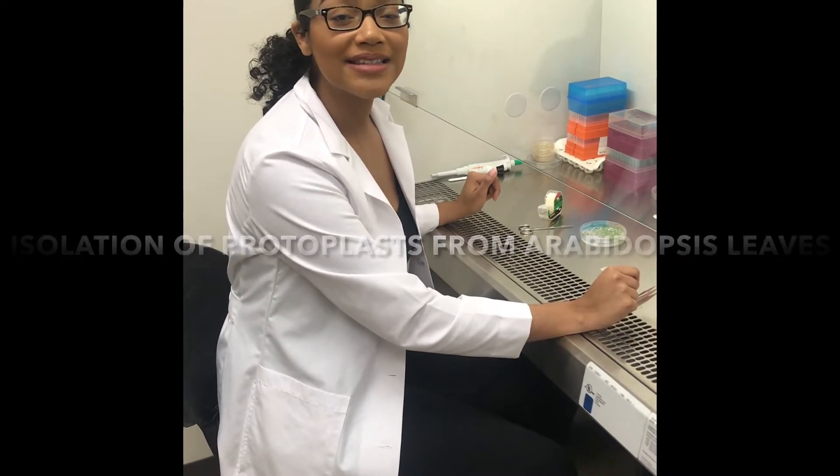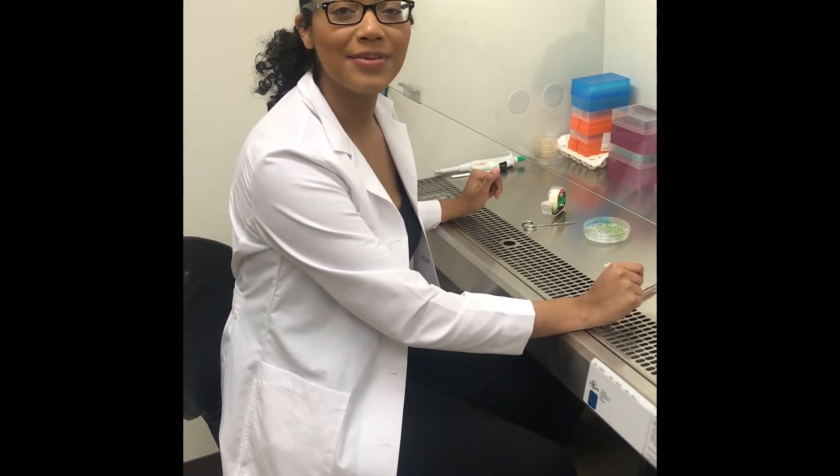Hello everybody. Today we're going to be isolating protoplasts from Arabidopsis thaliana leaves.